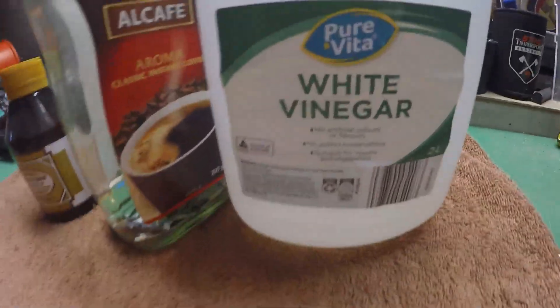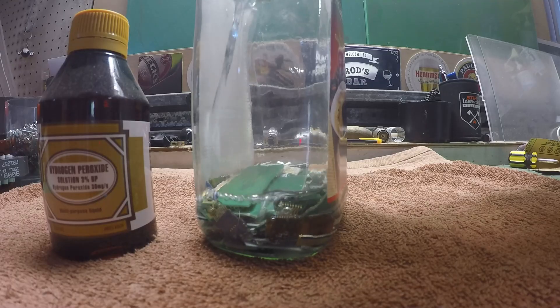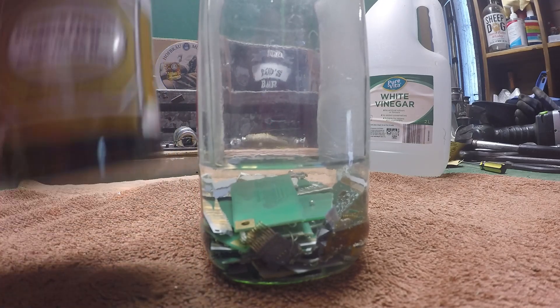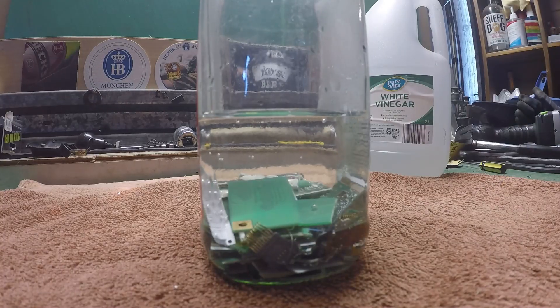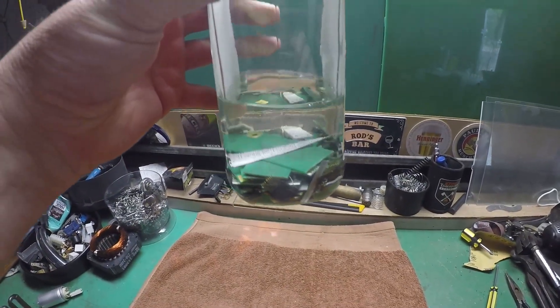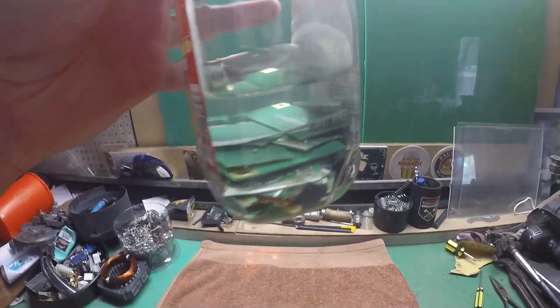Right, let's add the vinegar and the hydrogen peroxide — apparently just enough to cover. There's the vinegar. Now this is three percent; the video I saw said to use seven percent but I can't get hold of seven percent. I've kind of put equal quantities in seeing as it's only three percent. I'll put a lid on it loosely — apparently it's better with oxygen hitting it. We'll come back in seven days time — it's Sunday today — and see how it's going.